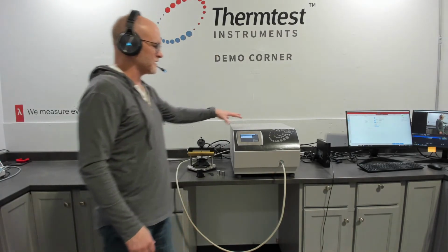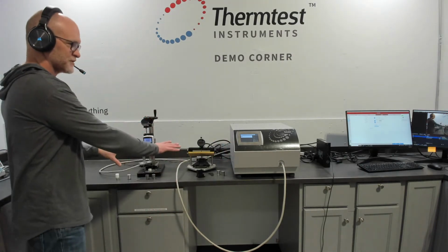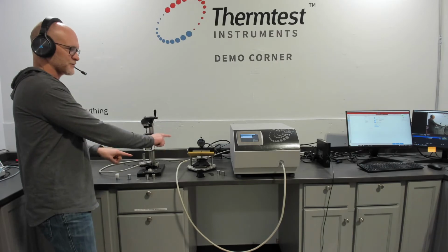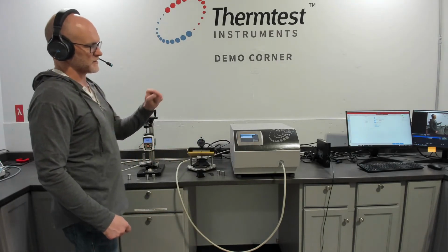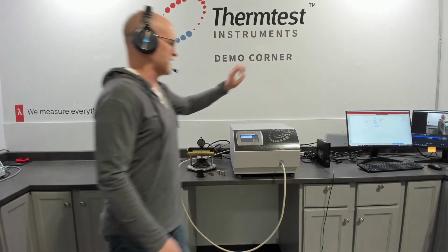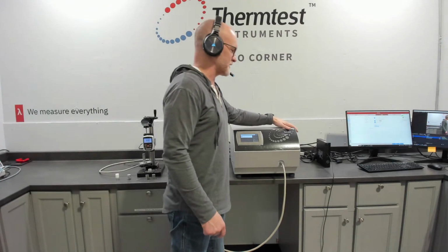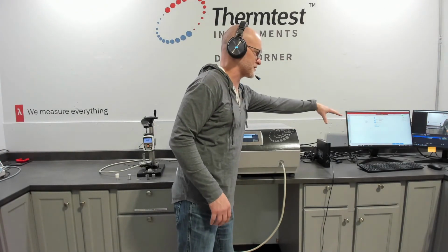What does that mean? That means you can run a sensor or multiple sensors at room temperature. Here we have 2 sample setups, 1 plugged in the front, 1 plugged in the back. But if you look at some of the other demonstration videos, you'll see there's other devices sitting here, and that's the additional capability, depending on the method you package with your MP1, to measure with temperature.